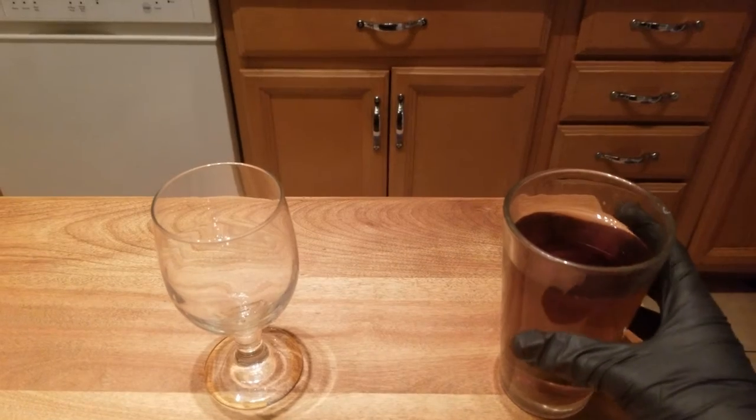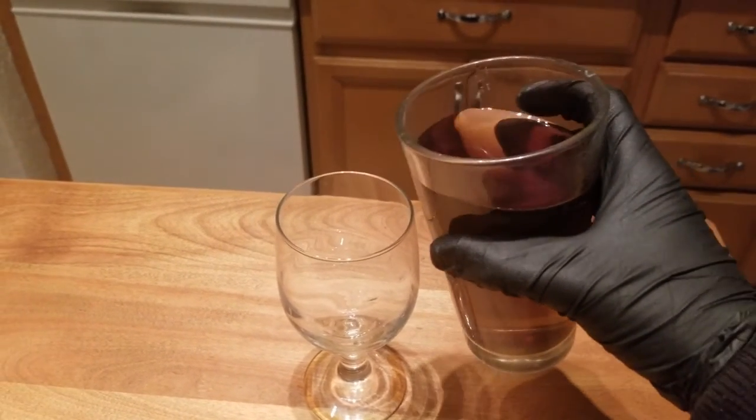This is Chemistry 1045 Laboratory, Experiment number 11, Oxidation, Reduction, Titration. In this experiment, we'll be investigating the use of oxidation and reduction reactions and the use of titration.